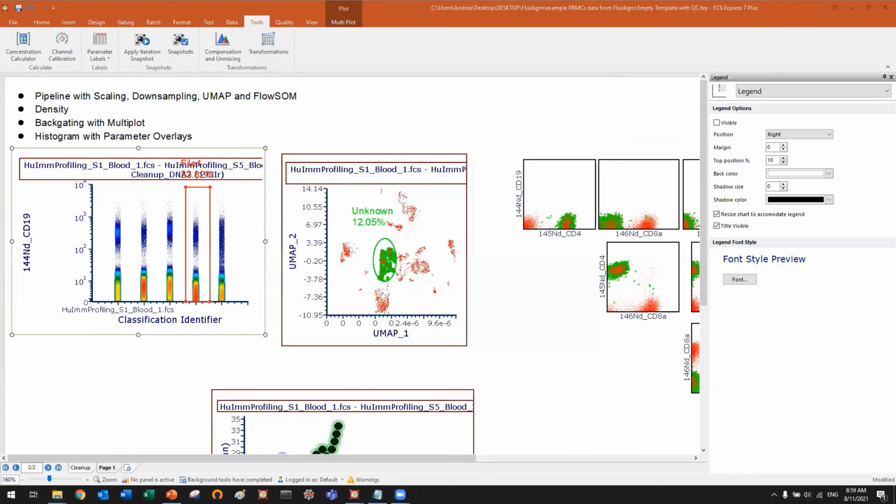So the question is whether only FCS format can be used in FCS Express 7. No, we are compatible with a wide variety of formats. And just to mention, you can also load CSV files if you want. So we are really flexible. FCS is not the only file format that you can load.